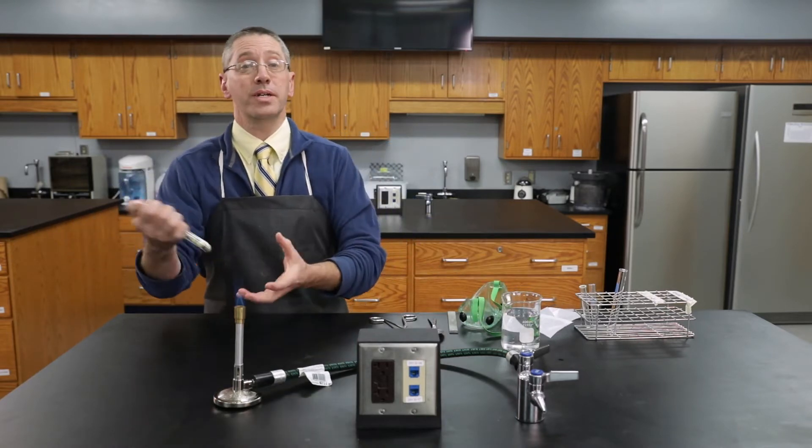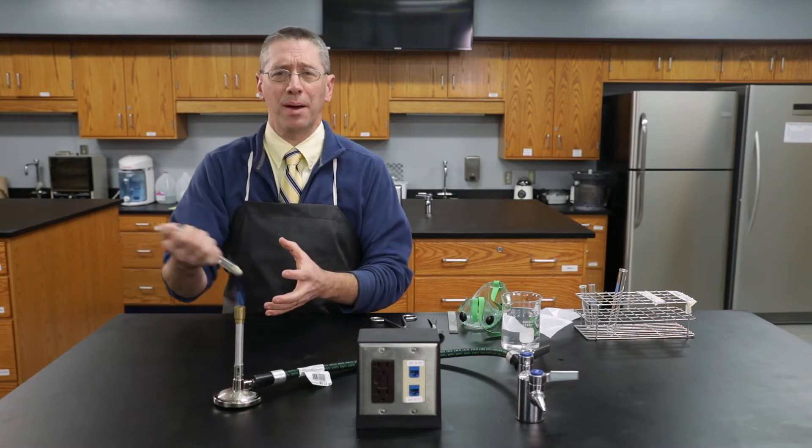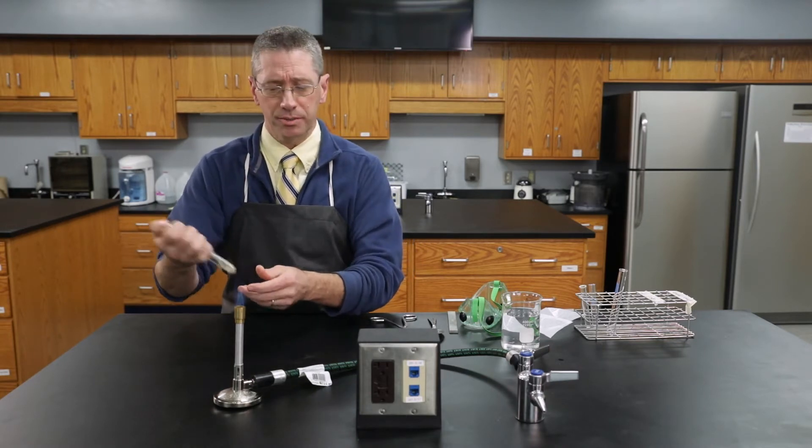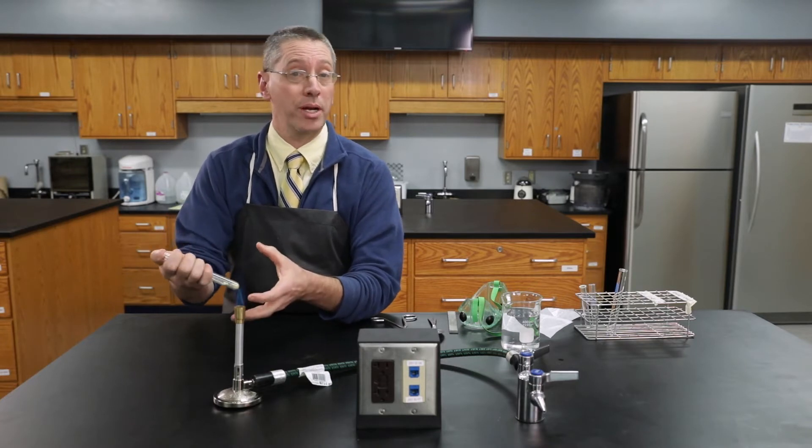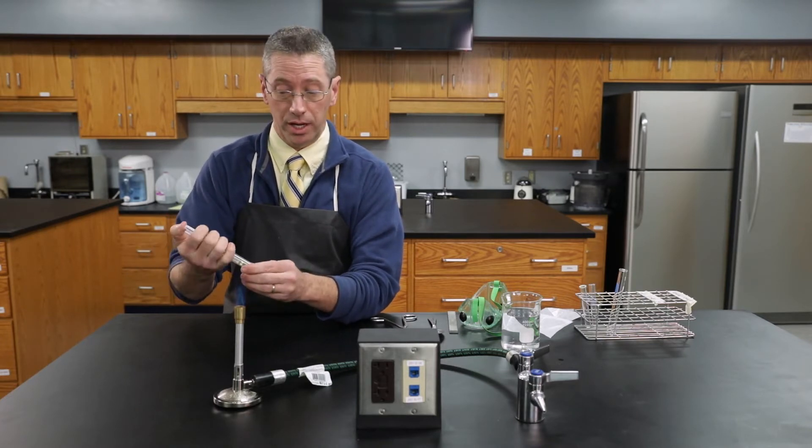So the first thing I need to do is mix these up thoroughly. There's no reaction happening yet, we're just making a heterogeneous mixture. And in fact if you wanted to you could separate it back out into its two individual elements.